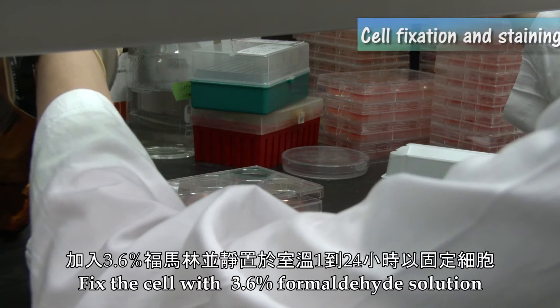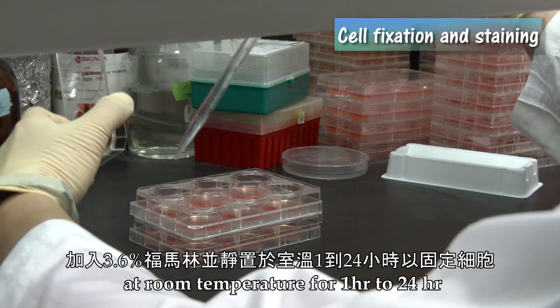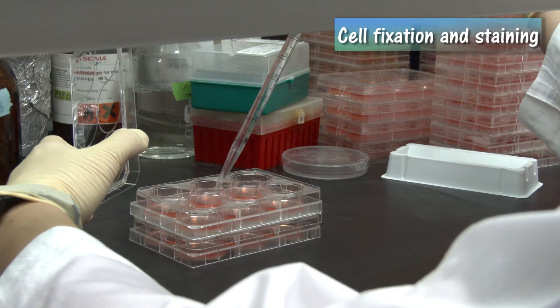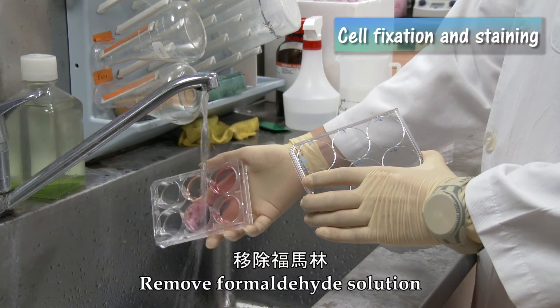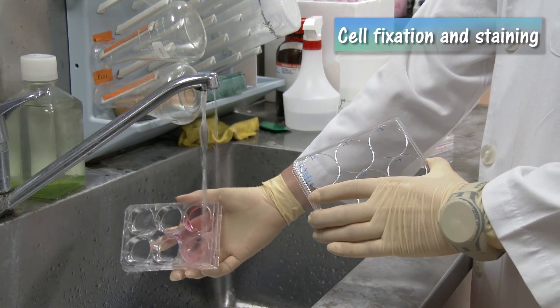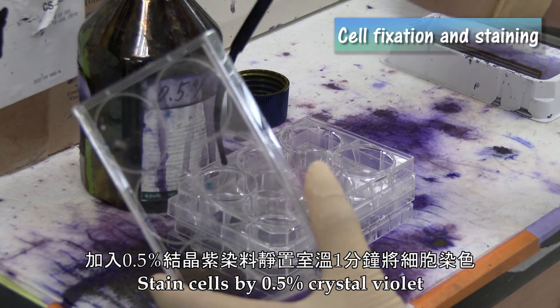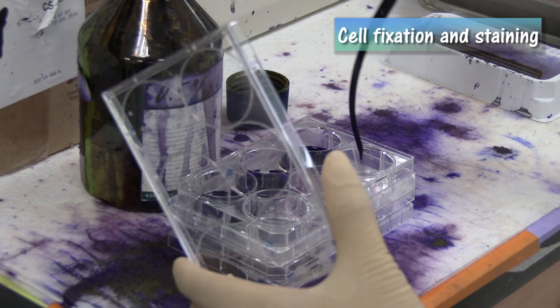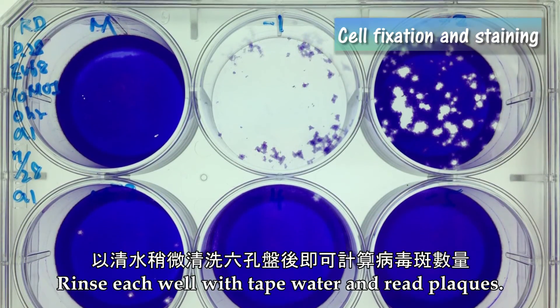Fix the cells with 3.6% formaldehyde solution at room temperature for 1 to 24 hours. Remove the formaldehyde solution, then wash out the agarose overlay. Stain cells with 0.5% crystal violet at room temperature for 1 minute. Rinse each well with tap water and read the plaques.